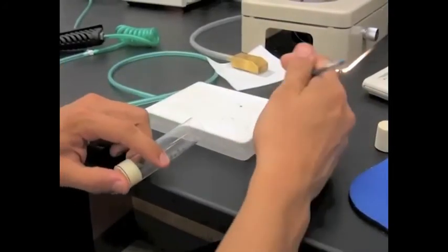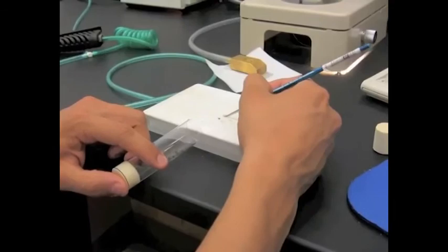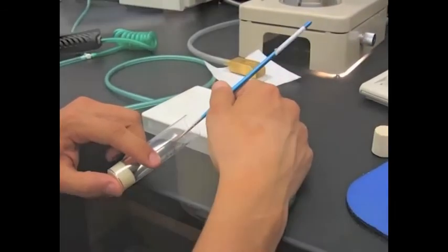Once your fly is imaged, they can then be placed back in their respective vials where they can wake up unharmed and ready for further experiments.